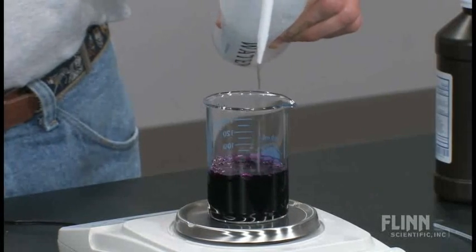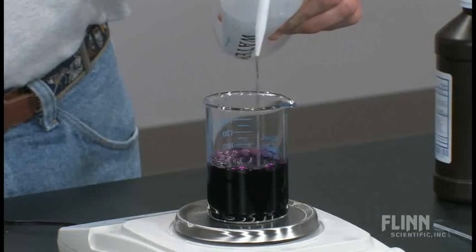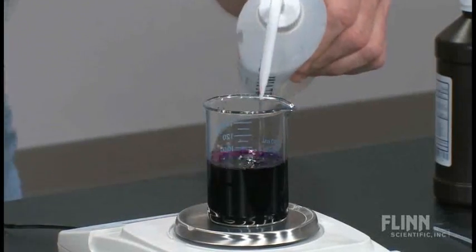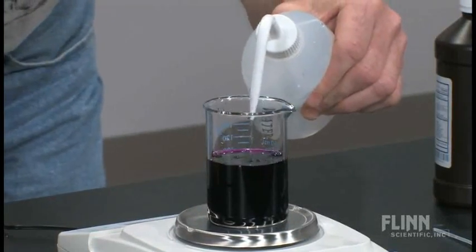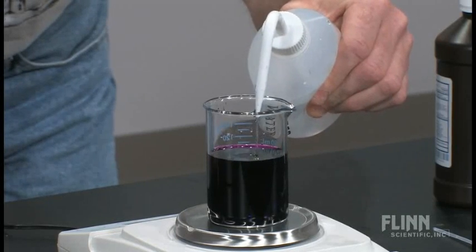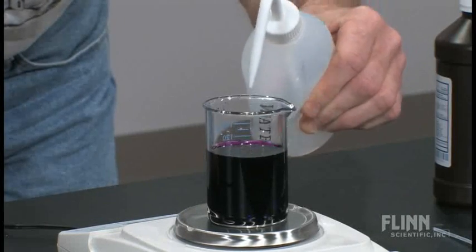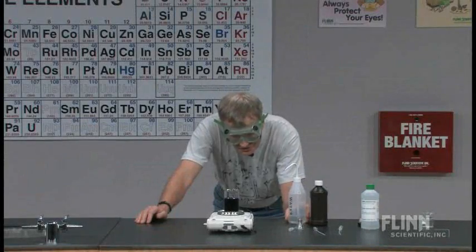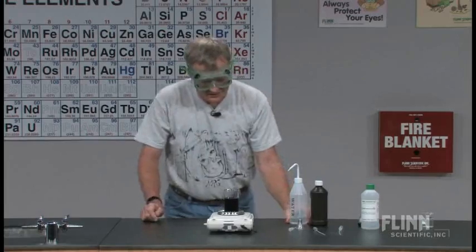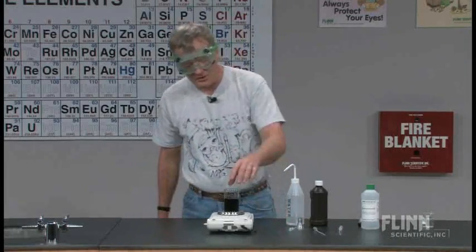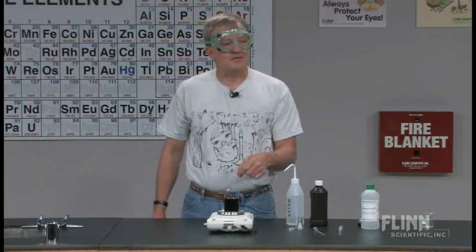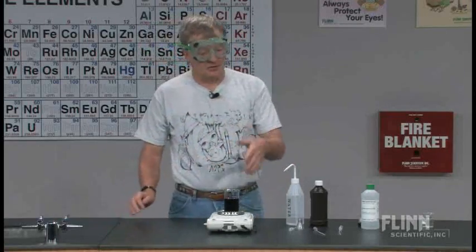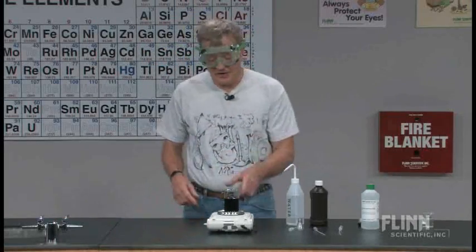I've got it up to there. There's a drop that just flew out, but we're not going to worry about that because we're just doing this for show. Right now I've got it there. I put the water in. Permanganate is pretty tough to get to dissolve, by the way. After you've done this I would set it off on the side on a magnetic stirrer and let it spin. What I have found is this, and we're going to go over to the board here now and look at the calculation.